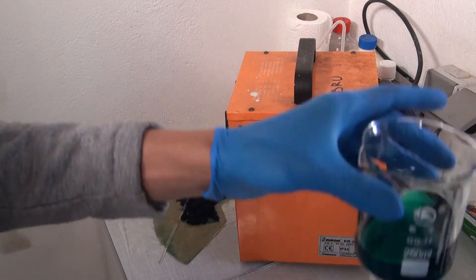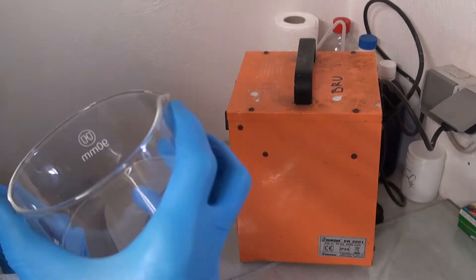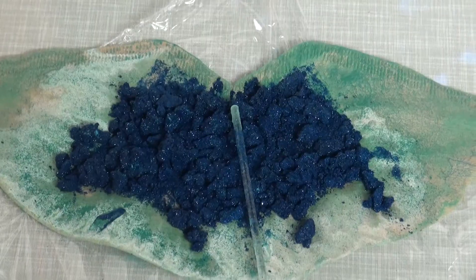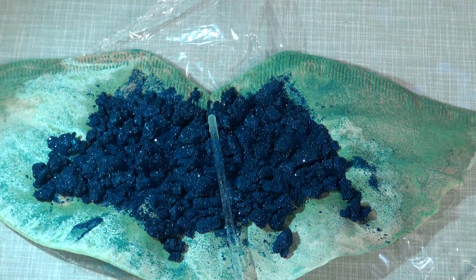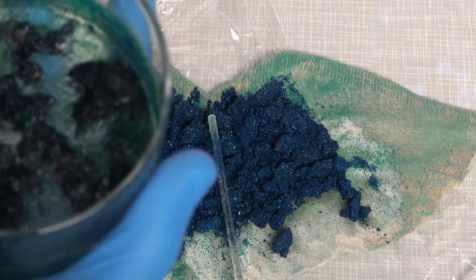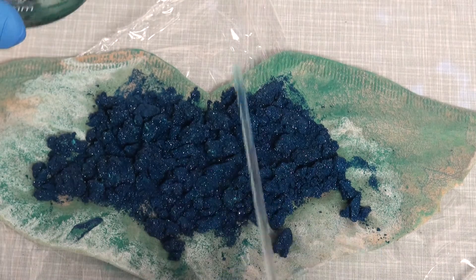I also tried to put the remaining solution into a crystallizing dish to get some bigger crystals. After one day the crystals are looking bright and gorgeous. The crystallizing dish on the other hand looks kinda sad — there were no bigger crystals, just some clumps.